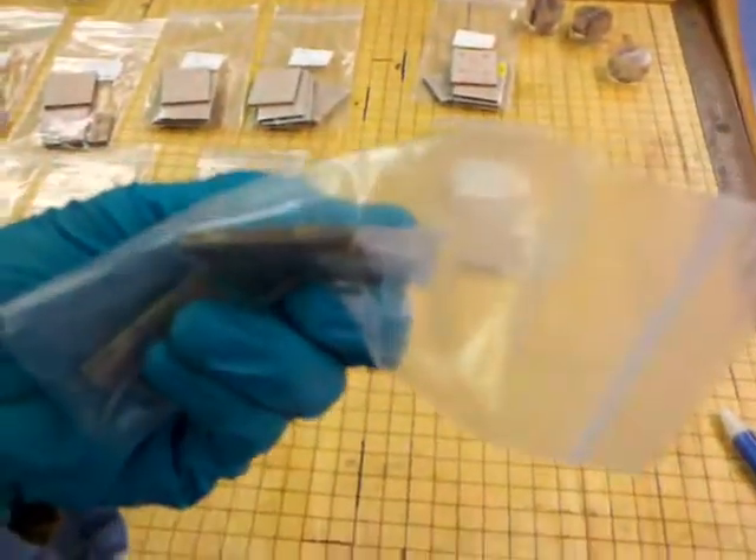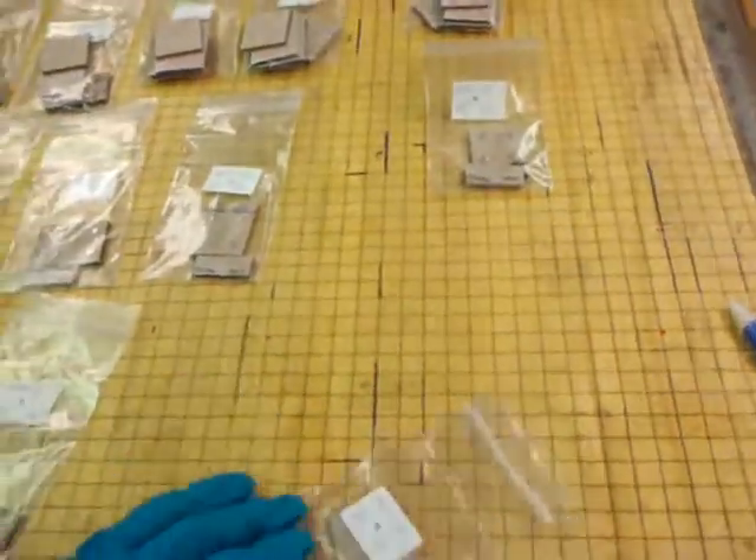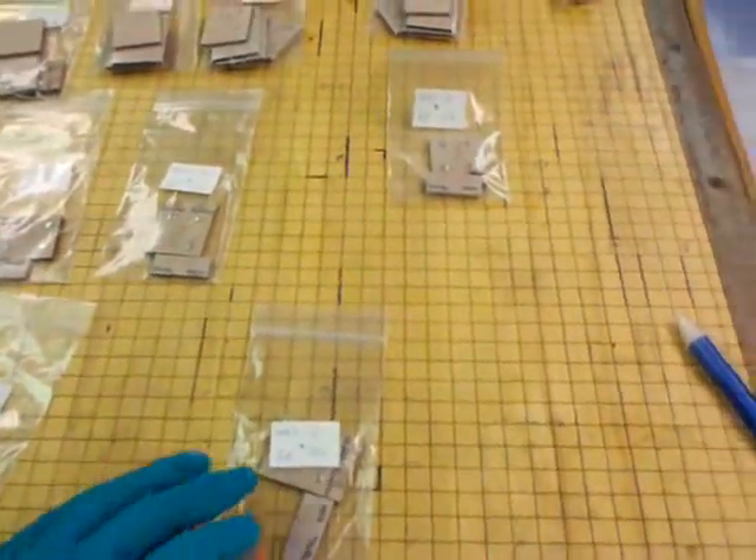It's probably hard to get a close-up here, but there are 28 layers in this thing — a lot of layers. It's pretty thick, kind of heavy for a circuit board. And there are a bunch of holes drilled into these boards. It's hard to see the detail, but the areas where it's whiter, that's where those holes are. I've got to saw approximately halfway through and grind out the rest on the polisher.